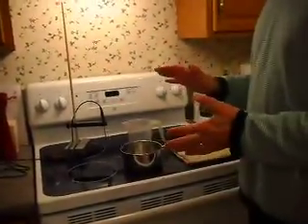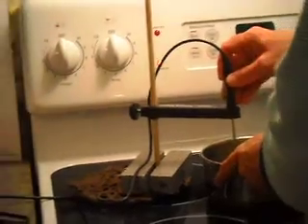Now, the cool part here is that rather than a thermometer, and rather than keeping track of our data manually, we have a data probe. This will sit inside the liquid and take the temperature automatically. Over here is the big thermometer reading that tells us our temperature. It lists our data. It's going to collect it all right here in this table. Then over here in the graph, it's going to generate the data. We can watch that in real time.